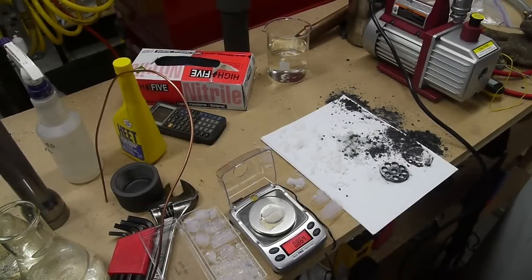But there's an easier way actually. Instead of transferring into liquid CO2, we can make the methanol itself go supercritical. So apparently this is how the first aerogels were made, just because the process is actually simpler in a way.